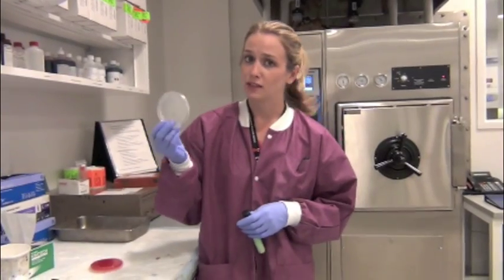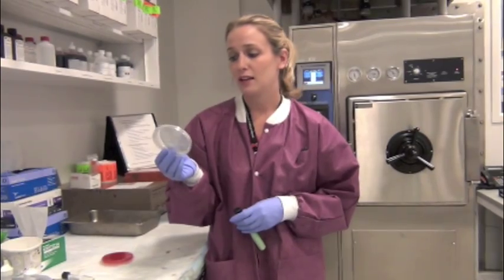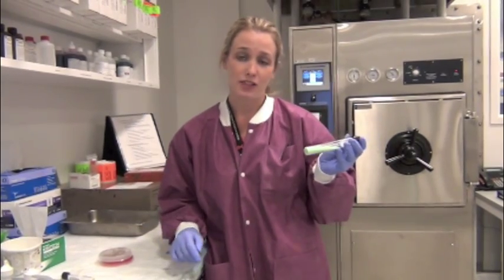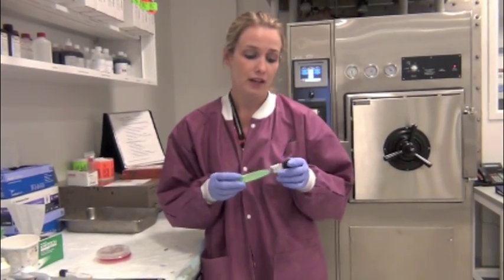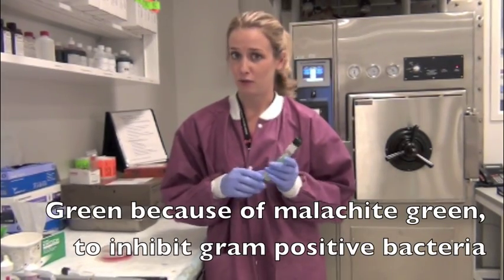7H11 is our agar of choice, which is what we use mostly. This is just an agar-based media that allows for the growth of mycobacteria. We'll also put some onto an LJ slant. This is an egg-based slant. The egg provides lipids for the mycobacteria to grow off of. The green color comes from malachite green, which inhibits gram-positive organisms.